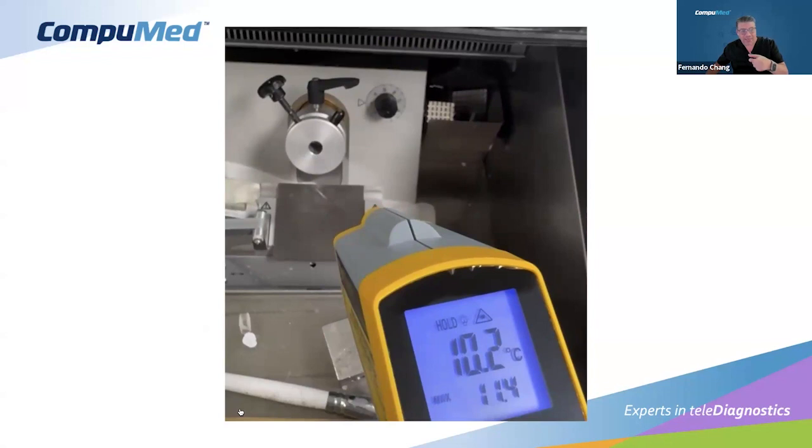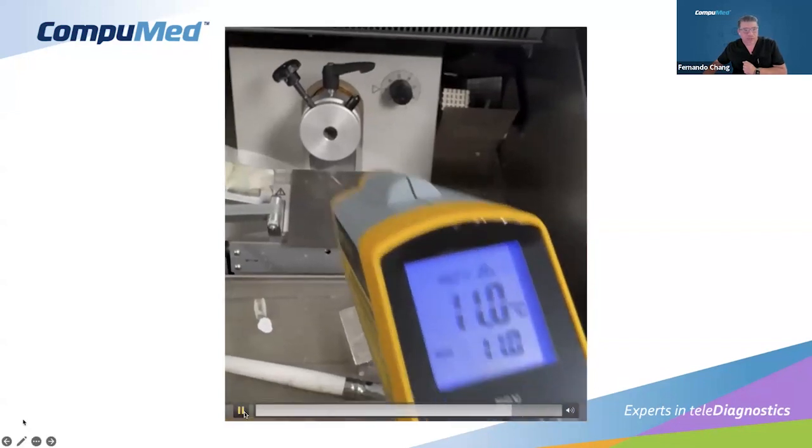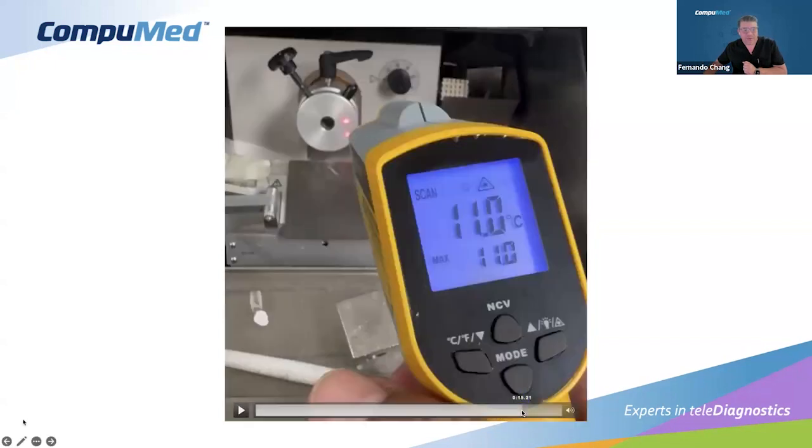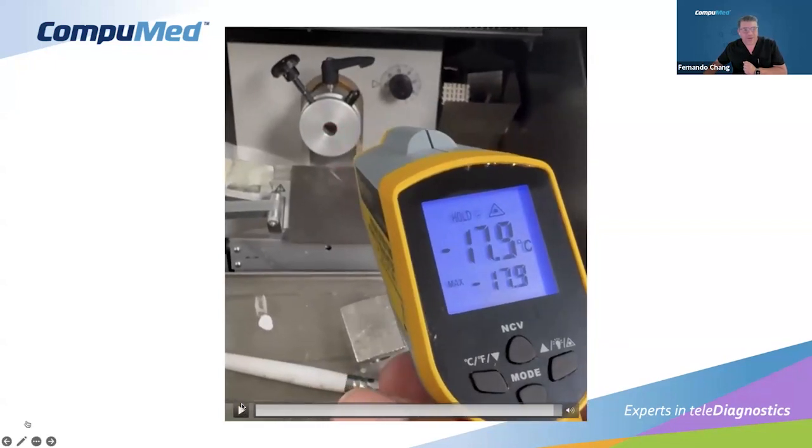It's because that plate is actually not connected to the entire stage, it's kind of floating. There's no blade there yet. When you put a blade and you connect it, that plate that is going to go to the tissue is affixed to the main stage, and the temperature is going to be transmitted through that, but right now it's not. But then look at the temperature now, and you can see the temperature right there where the sample is going to go.